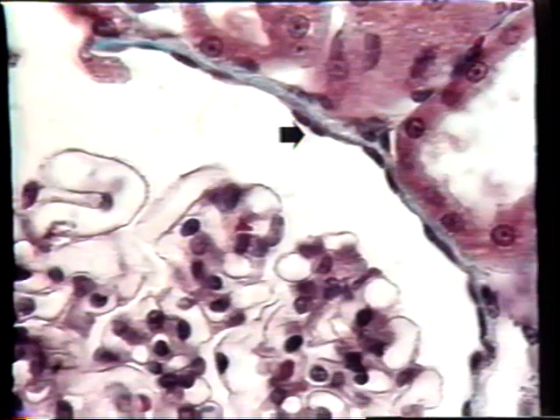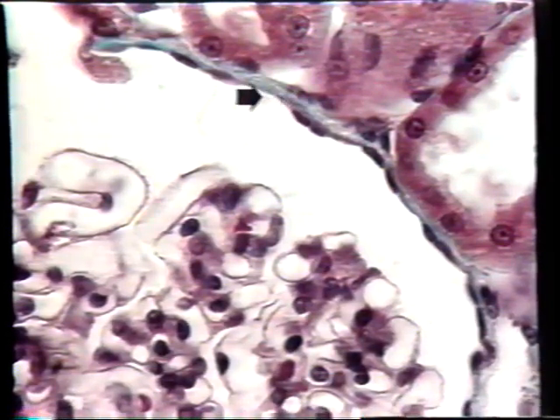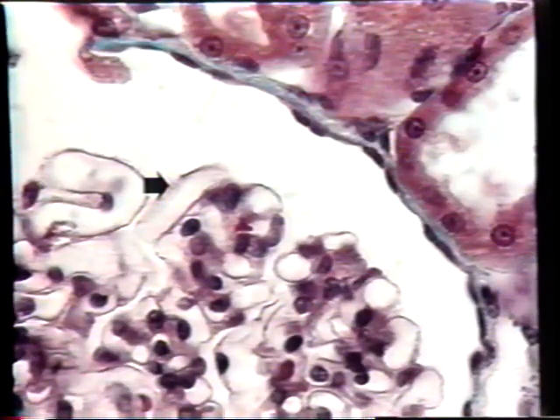This section has been stained by a particular stain called Masson's trichrome, and it's very nice because it will stain the nuclei of cells purple, it'll stain the cytoplasm red, and it will stain connective tissue green. So this green line here represents the basement membrane, the connective tissue, upon which this simple squamous epithelium sits. There's another kind of simple squamous epithelium in here. It's the epithelium that lines this bundle of capillaries, the glomerulus, which is in the middle of Bowman's capsule. These cells are so thin and flat, so squamous, that you can hardly see them. Their cytoplasm just looks like a hair.